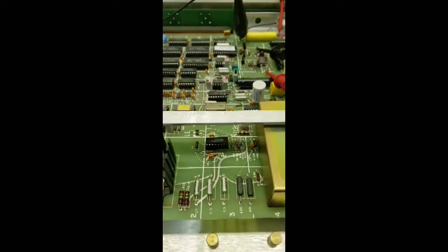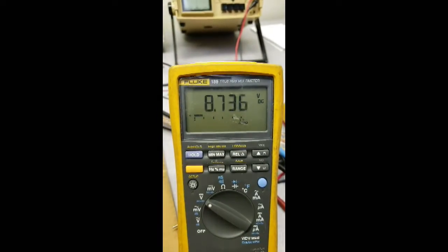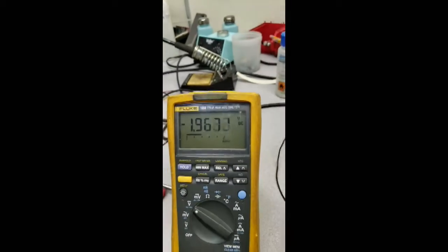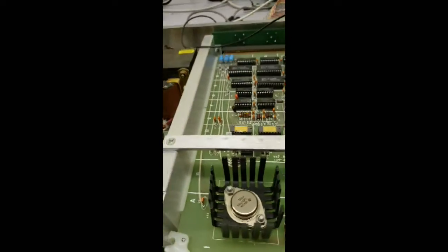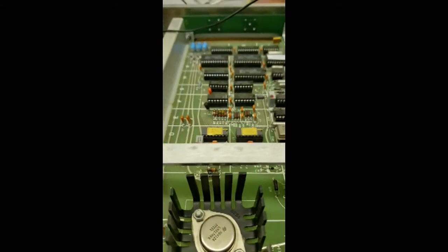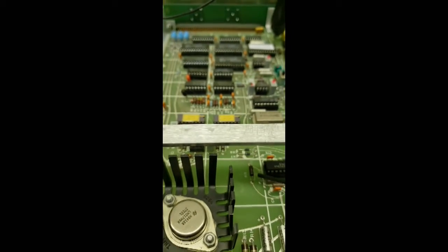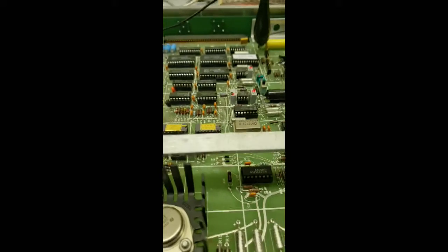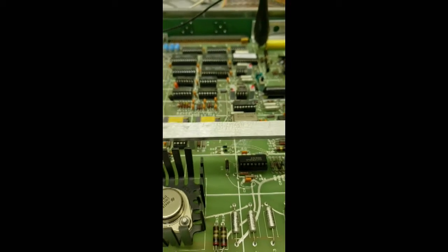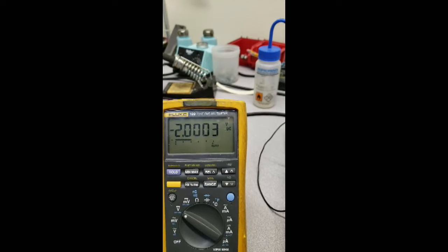Now it's failing. You can hear that clicking. That's the relay that's clicking. Fine supply is oscillating quite a bit. High voltage is oscillating quite a bit. Now we'll take some cool spray and cool down R15. Now the relay is no longer clicking. Fine supply is stabilizing. High voltage supply is stabilizing.